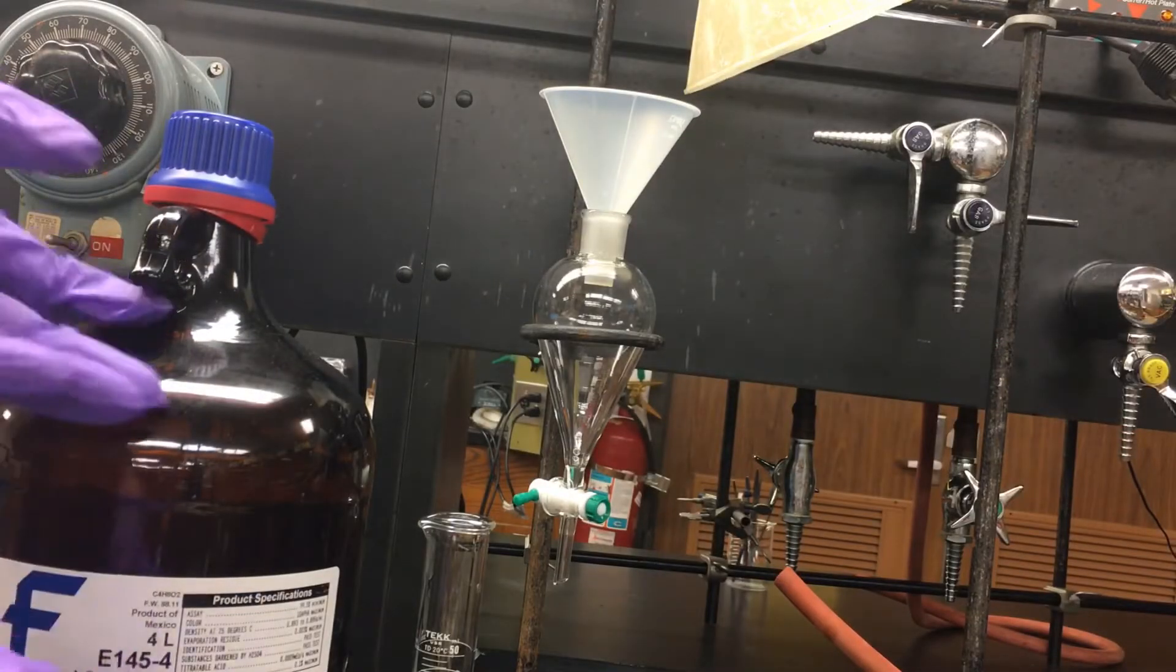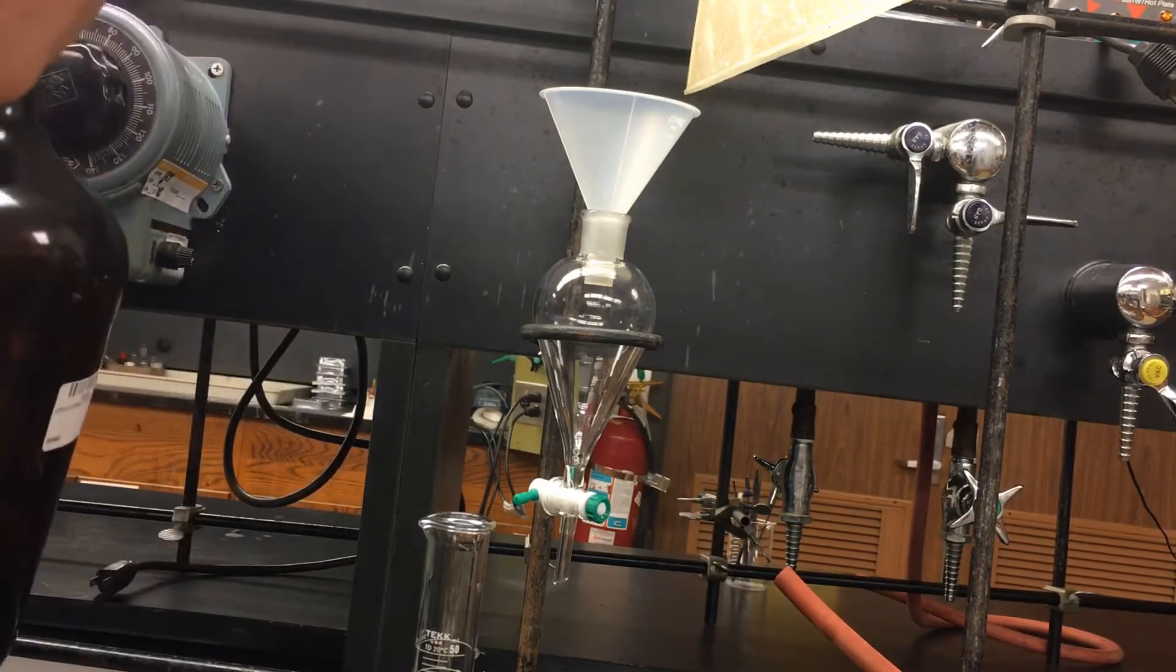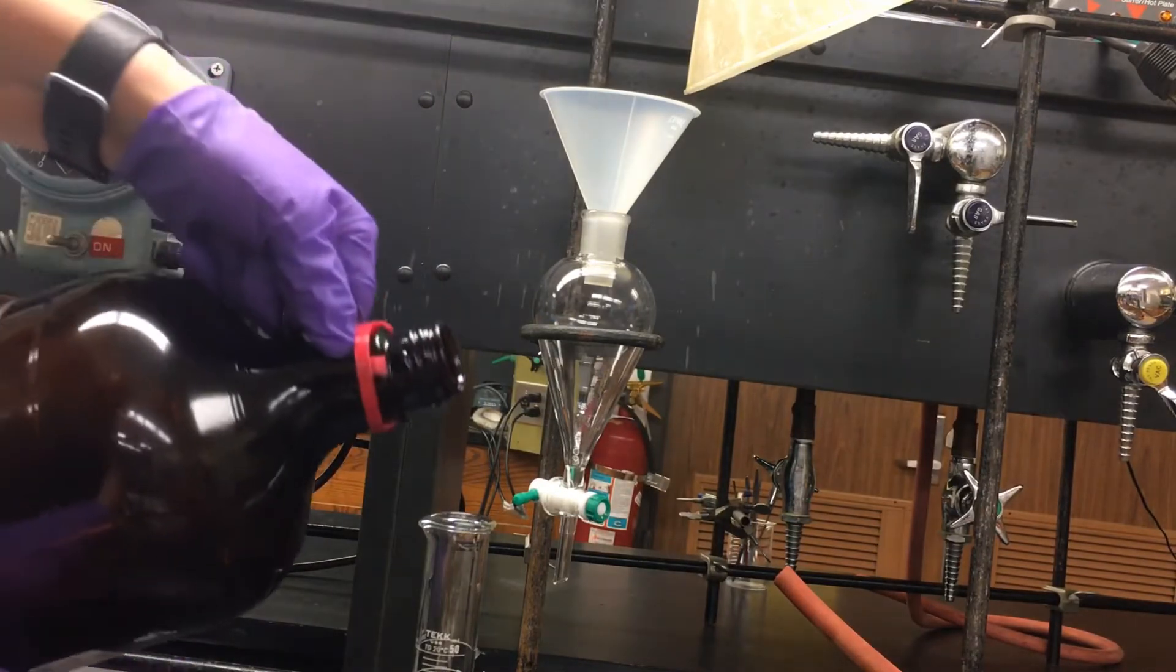I've now removed the stopper and replaced it with a funnel which is used to add liquids to the separatory funnel.